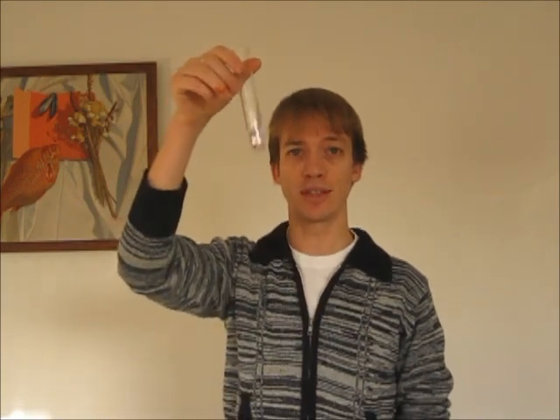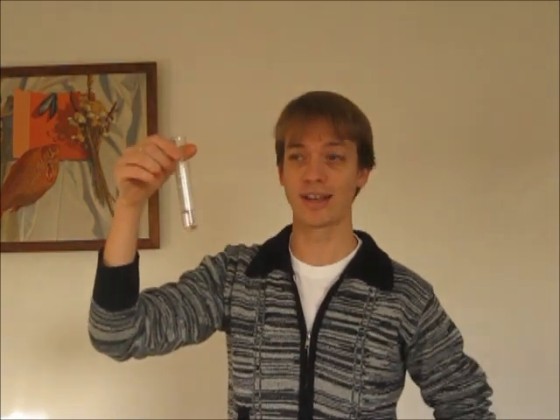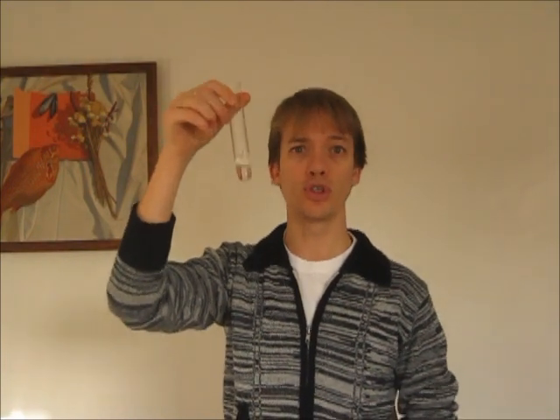Here I've got some acid in this boiling tube, which is a bit like the acid in my stomach when I've got too much acid in it. I want to neutralise it. There are three different types of substances that I can use to neutralise an acid.